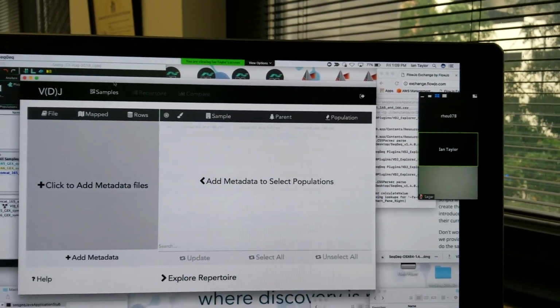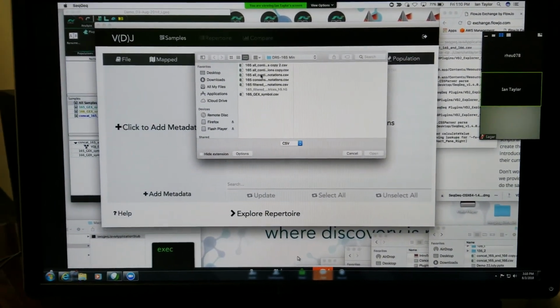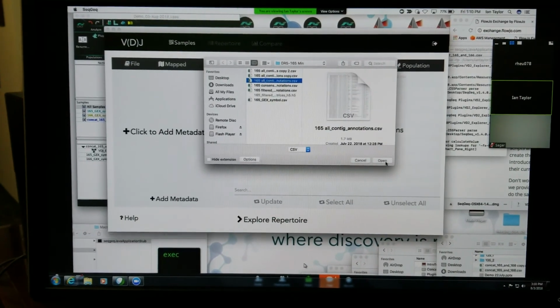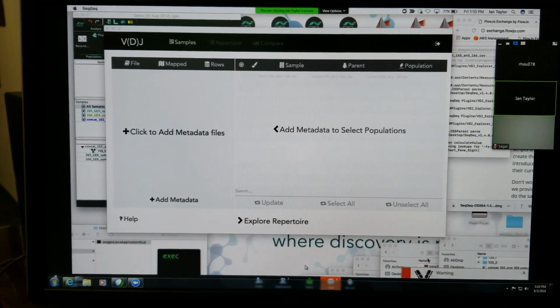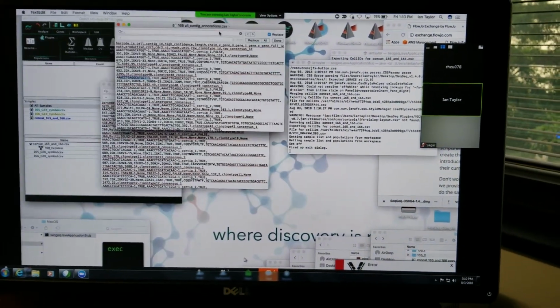Maybe not. Maybe I messed that up. Try one more time. Should be all contig annotations. No, it doesn't want to load now. These two pieces of metadata.